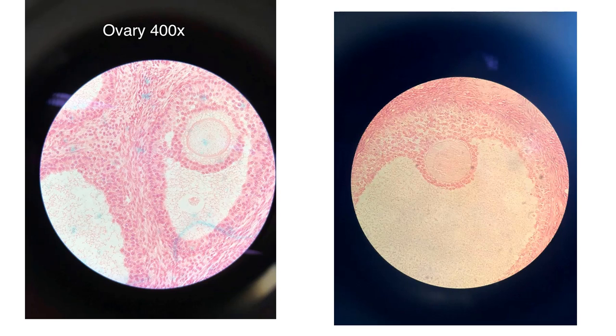Now let's look at some microscope slides. This is a microscope slide of the ovary, and specifically what you're looking at is a Graafian follicle that would be inside the ovary. So different parts of the follicle, remember, a Graafian follicle is a mature follicle, so you've got the secondary oocyte. You've got this clear ring called the zona pellucida, a ring outside of that with these cells, the corona radiata, and the big fluid-filled space would be the antrum.